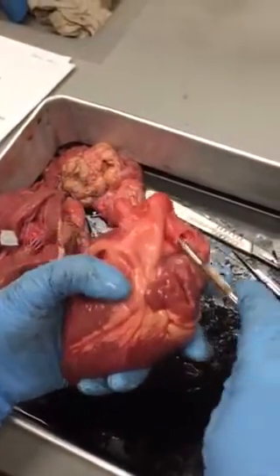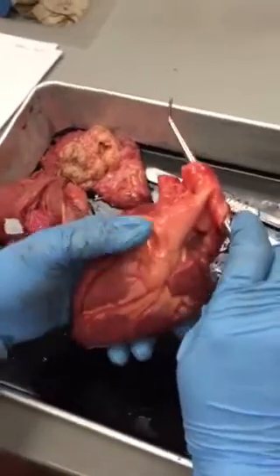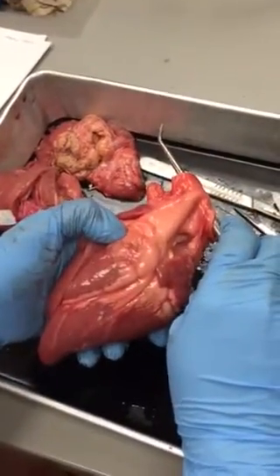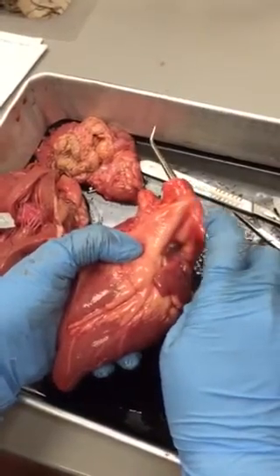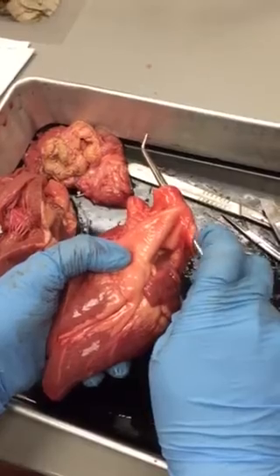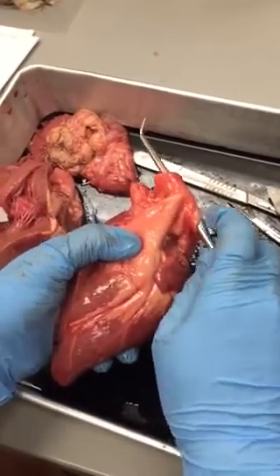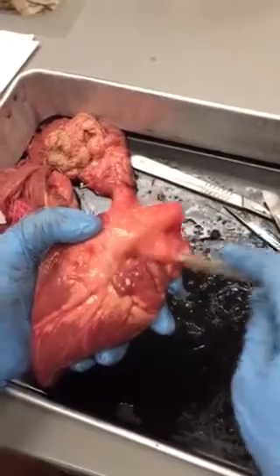The pulmonary trunk has 2 openings here because it will divide into the right and left pulmonary arteries. This heart is a very good demonstration because they cut the arteries closer to the lungs, so you can see the right and left and how they come together to form your pulmonary trunk.